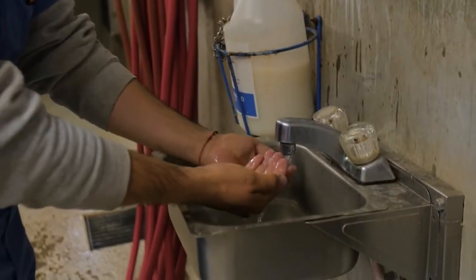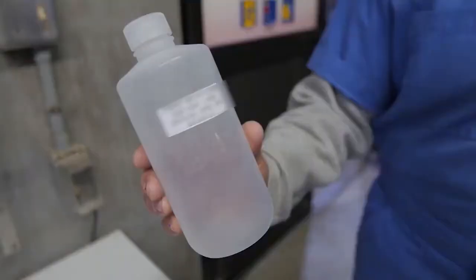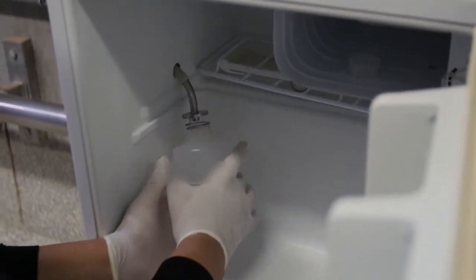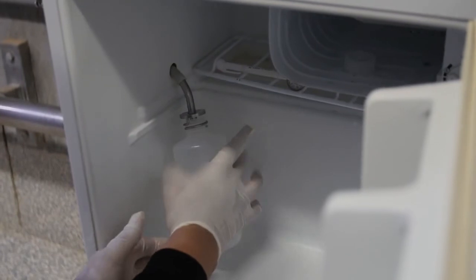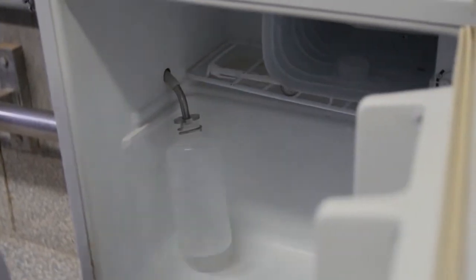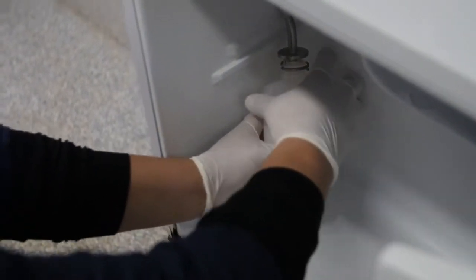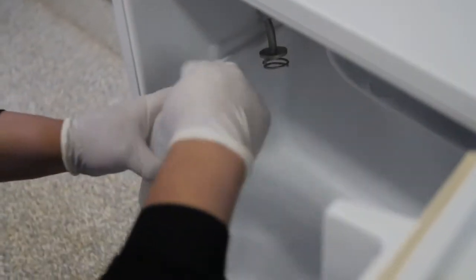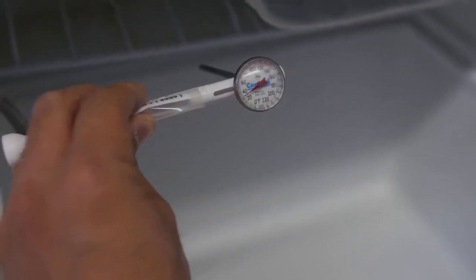You must wash your hands before handling any of the equipment. At the beginning of filling a new tanker, make sure the sample bottle or sample collection container is cleaned, sanitized, dry, and properly positioned to collect the sample. You must also protect the bottle cap so the bottle can be resealed after filling without contaminating the sample. After filling each tanker, remove and cap the sample container, which should be no more than three-quarters full, from the sample collection refrigerator.